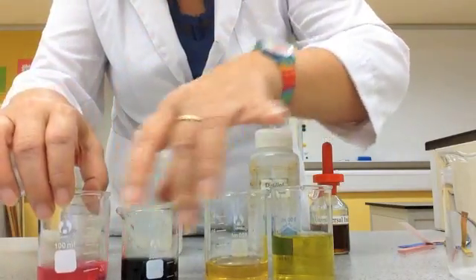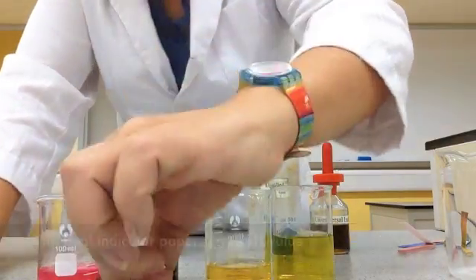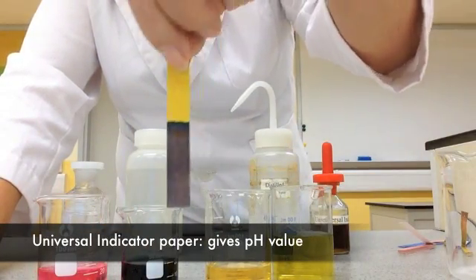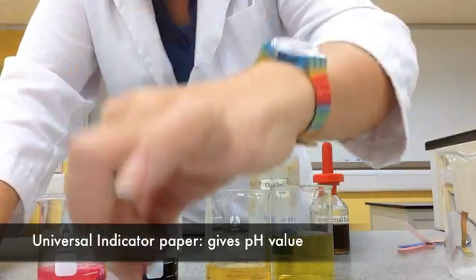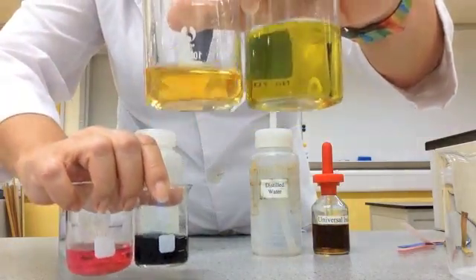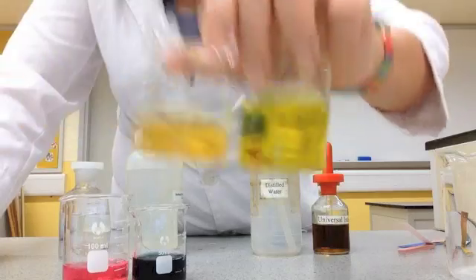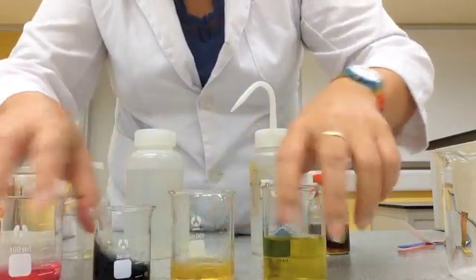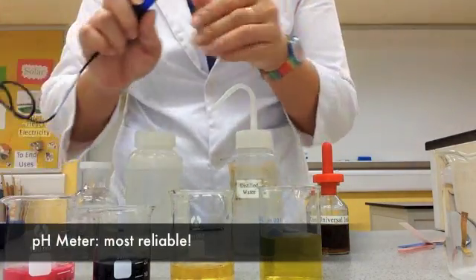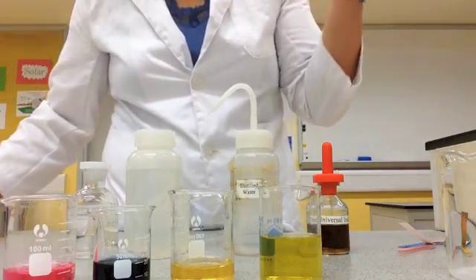The litmus paper just tells us whether something is acidic, alkaline, or neutral. The yellow universal indicator paper tells us the pH value, but it's not very accurate. As you saw, both the litmus paper and the universal indicator paper gave similar results but different colors. The most reliable method would be using our pH meter.